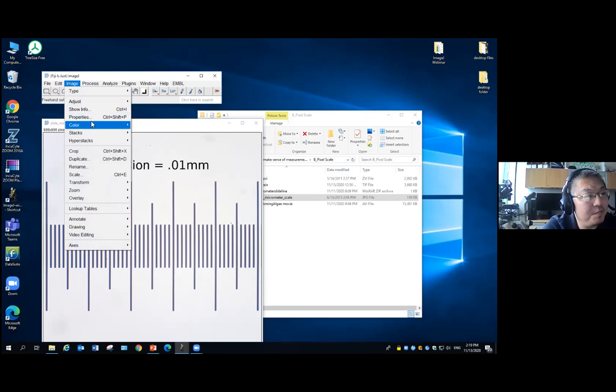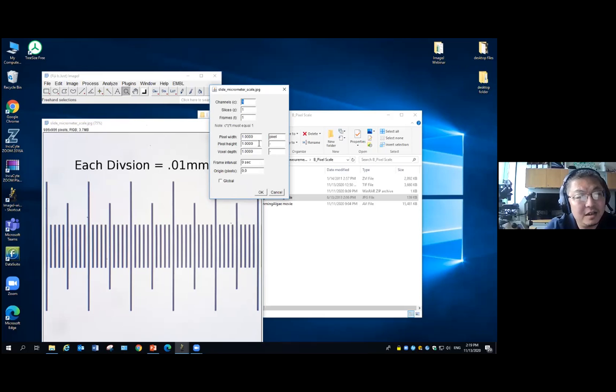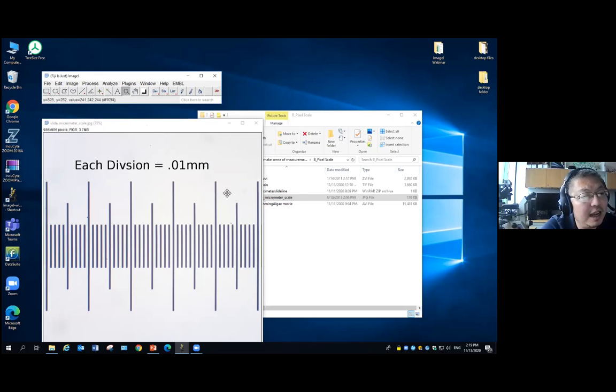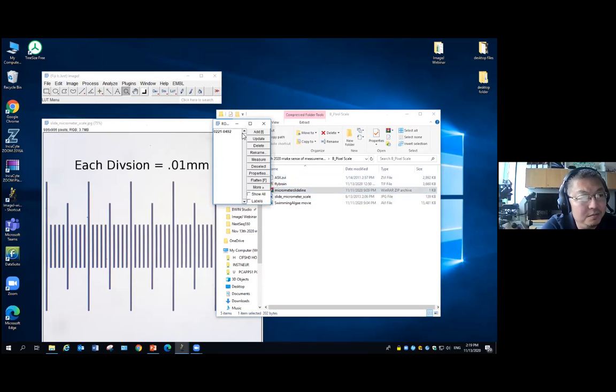Then I have this picture. I check my pixel properties. As you can see, it's a single pixel. We cannot get the pixel scale. But now what we can do is draw a line. Actually, I already drew it. I'll just show it here.